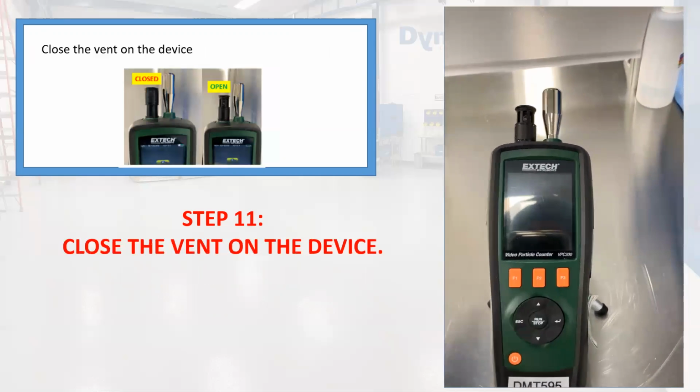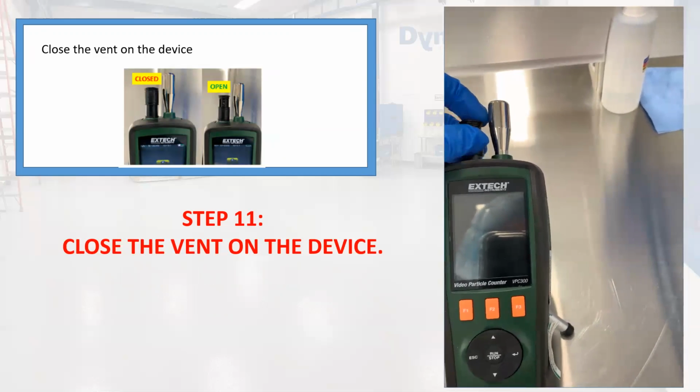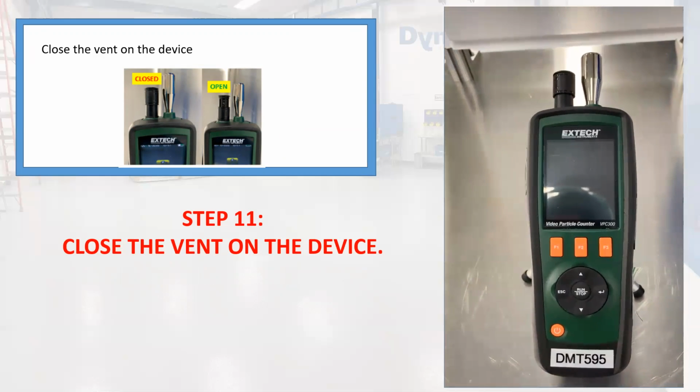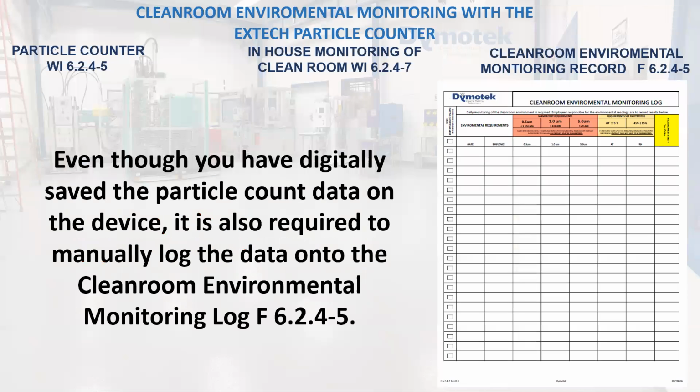Close the vent on the device. Even though you have digitally saved the particle count data on the device, it is also required you manually log the data onto the cleanroom environmental monitoring log.